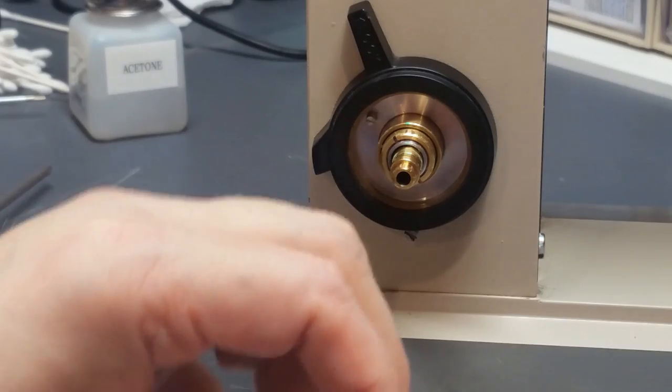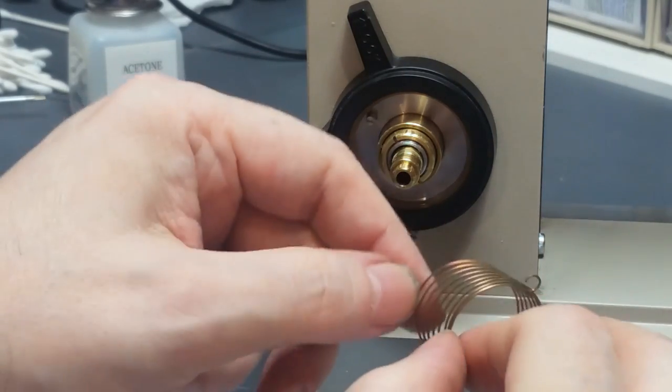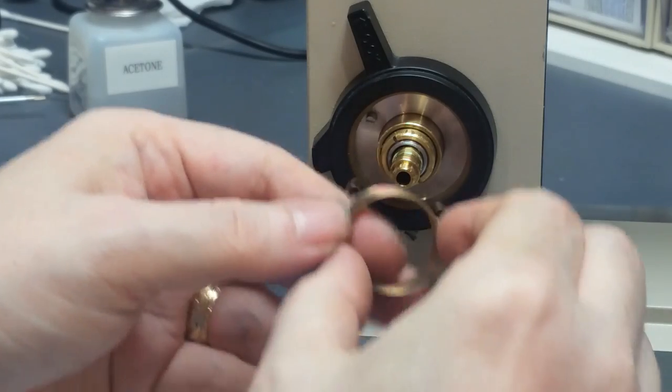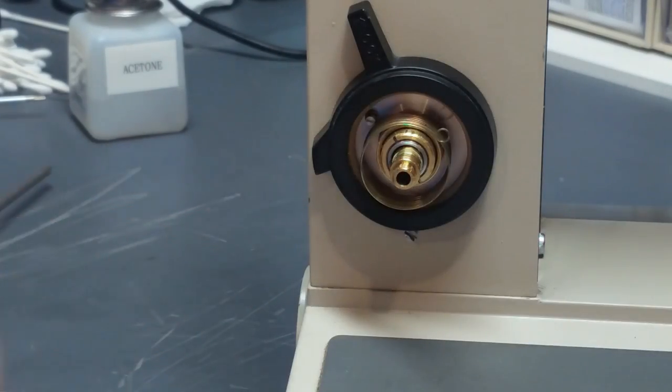Next step. Take your coil spring here. You've got two loops in there. The loop in the back, place it over that pin and put your spring in position like that.